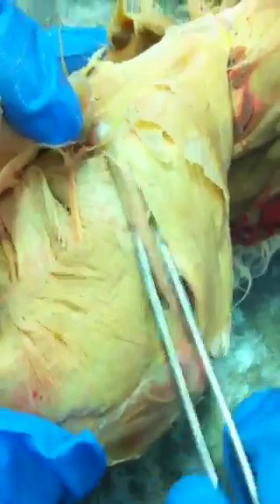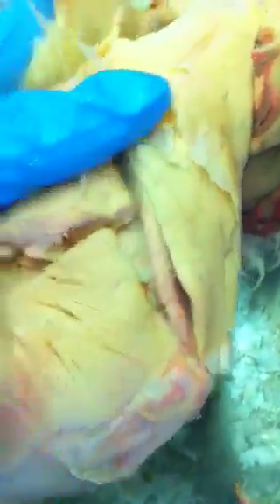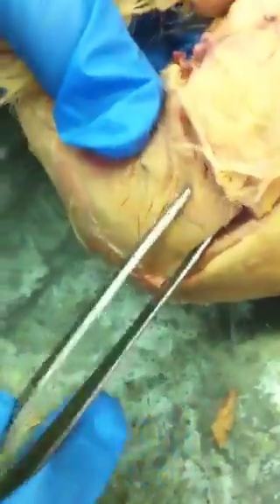Vastus intermedius. And this is the biceps femoris — this is the cranial biceps. This is the caudal head. So this is the cranial head and this is the caudal head. This part is the caudal, and this is the cranial.